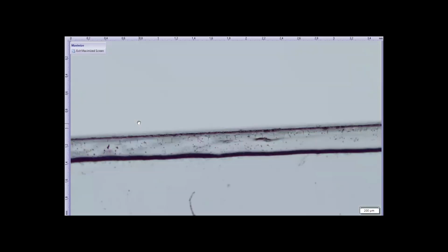Okay, this is the eye from a bat. It's called the little brown bat, which is one of the common bats that we have in this area. So it's what we would call a microbat. And microbats, as you probably know, catch insects on the fly, not using vision, and at night, not using vision, but by using echolocation. But they do have eyes. They have teeny tiny eyes. But they're fully developed eyes. They have everything you'd expect to find in an eye.